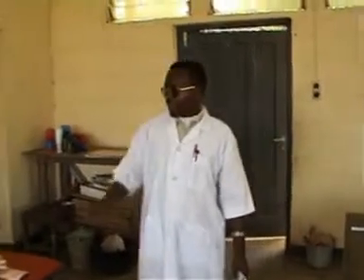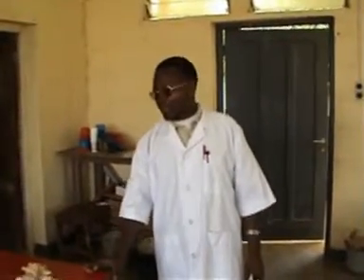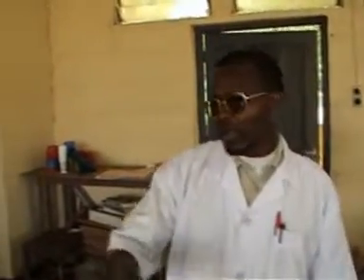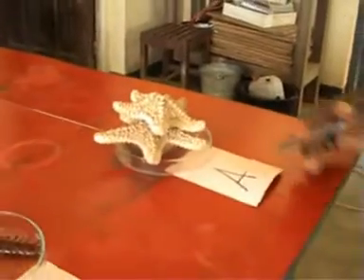When candidates get into the lab for biology practicals, the first thing they will notice is that they will observe a lot of organisms placed before them. They will see a variety of organisms placed on any side, as we have here.